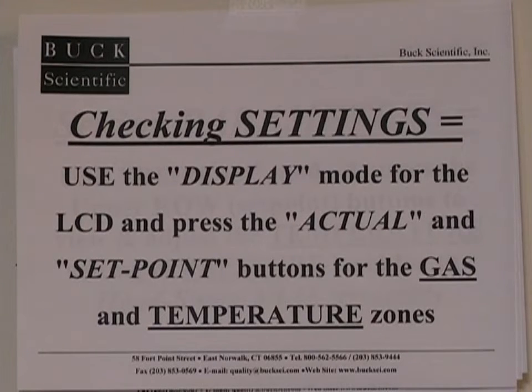Once all of the gas and electrical connections and plumbing connections are completed, we can now turn on the GC and check the various temperature and pressure zones to make sure they are within the parameters we need for our analysis. Most often these will be preset to the optimum conditions based on your column and your application, but they can be user adjusted very easily as you will see.